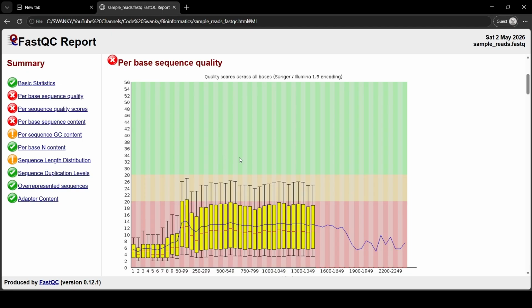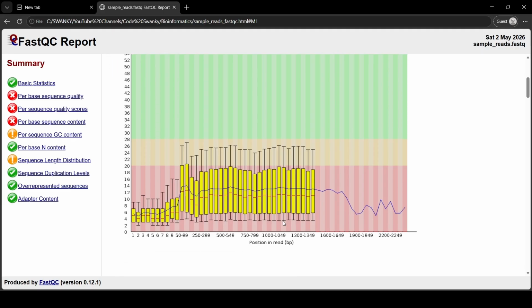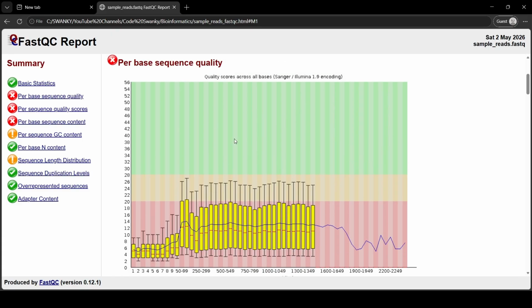The background is painted in three colors basically. The green means very good quality, orange means reasonable quality, and red means poor quality, which also means very high error rates. So for every position across your millions of reads, FastQC draws a yellow box and whisker plot. The red line in the middle of the yellow box, you can see over here, is the median quality score for that specific base position. So in a great data set, all the yellow boxes will be floating high up in the green zone over here across the entire graph.